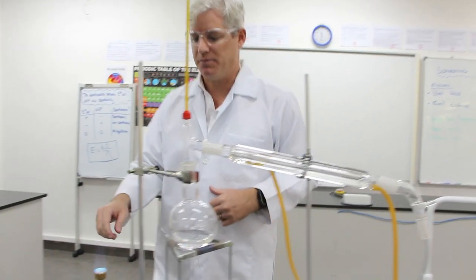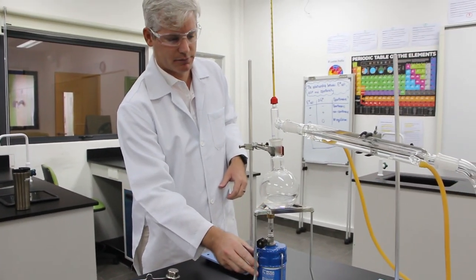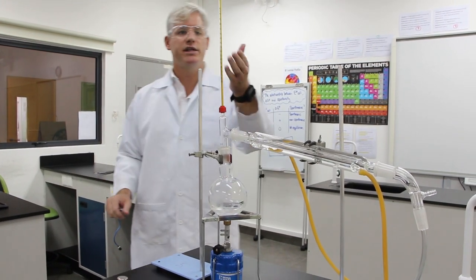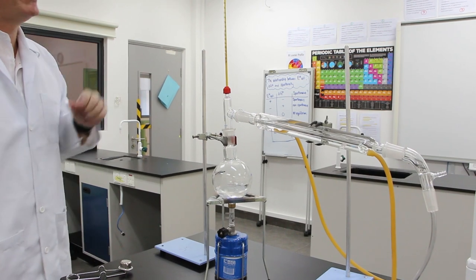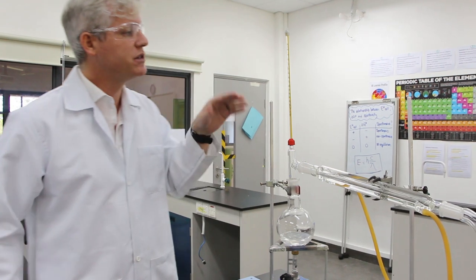So let's give it a go. Now we need to watch the thermometer and manage the temperature. If we let it go too high, the water will start to boil as well, and we don't want that. We want to separate the two liquids, so we want to keep the temperature at about 78 degrees.